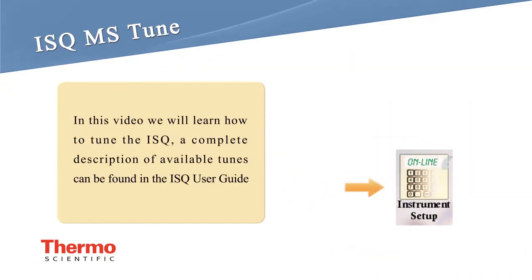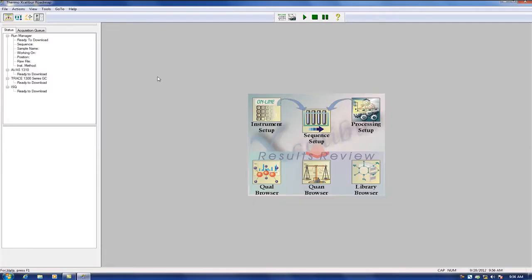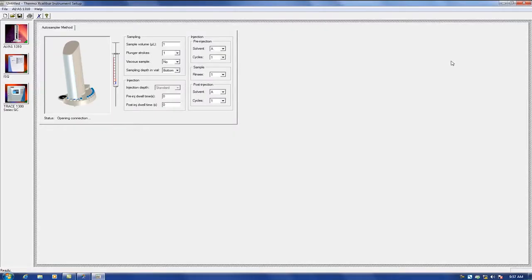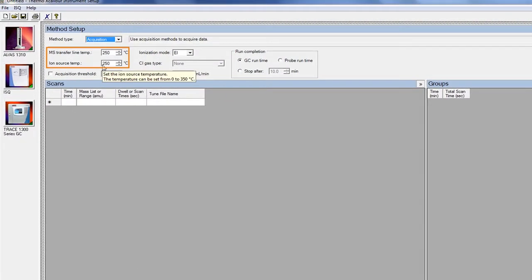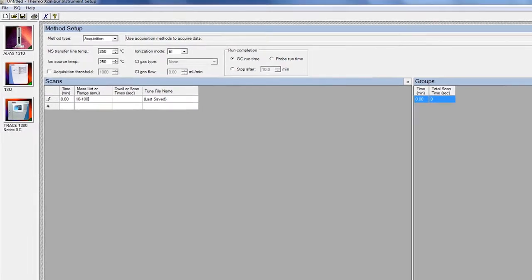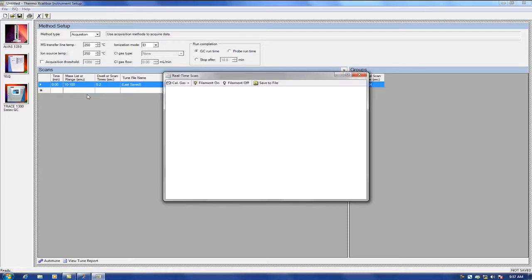In this video, we will learn how to tune the ISQ MS. Open Xcalibur and click Instrument Setup. Select ISQ. First, confirm that the transfer line and ion source are at the correct temperature. Set the scan range from 10 to 100 and then right-click. Choose Scan Now to start scanning.